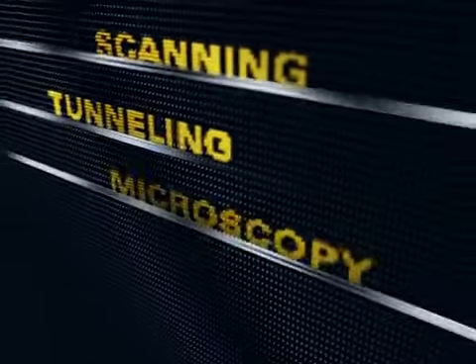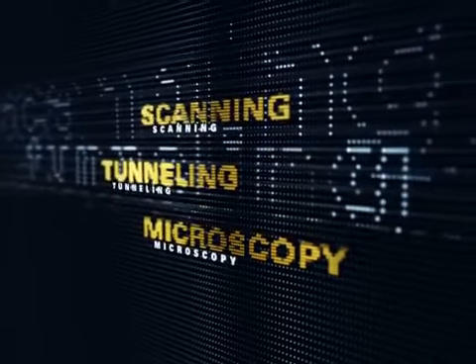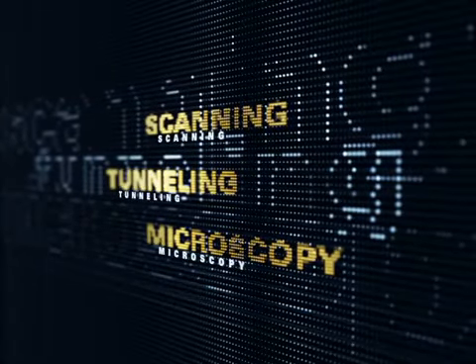Scanning tunneling microscopy, a close look at surfaces, atoms, and the electronic properties of nanostructures.